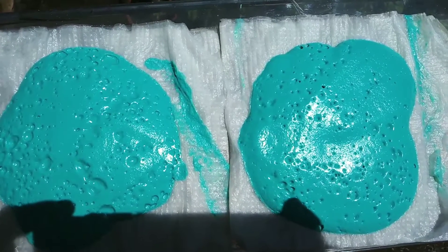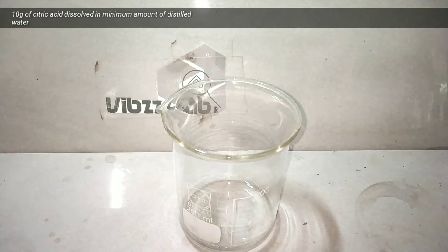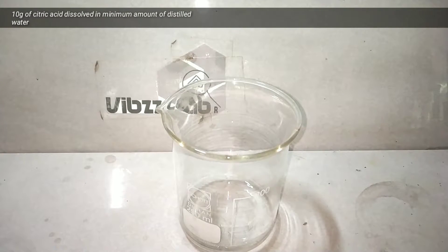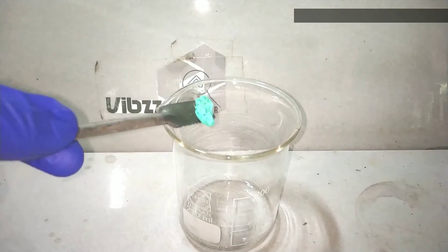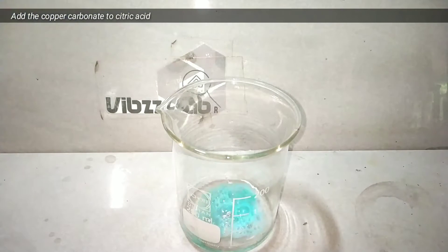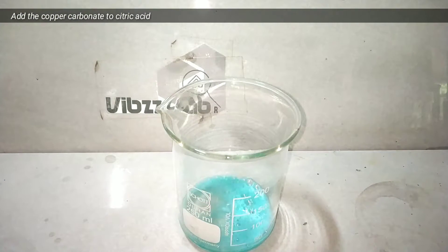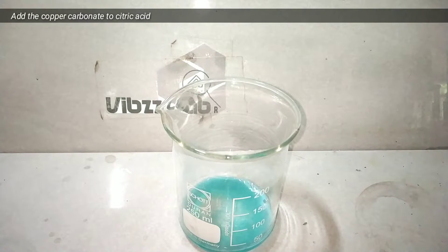Next I had to make a solution of citric acid. For that I dissolved 10 grams of citric acid in a minimum amount of distilled water. Then I started to add the copper 2 carbonate slowly with the help of a spatula.